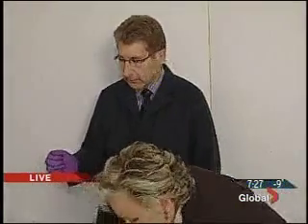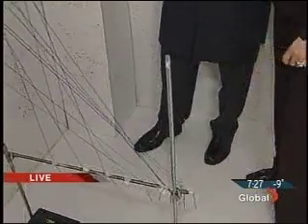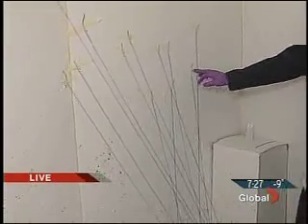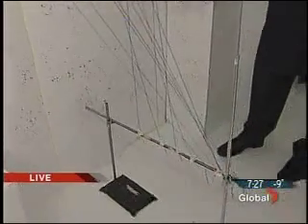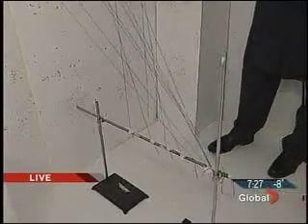That impact angle could be anywhere, depending on the stain, from 0 to 90 degrees. And these stains generally have been approximately 45 degrees. So with the aid of a protractor, I string from the stain to an area of convergence, which is indicative of the circular stains on the wall.